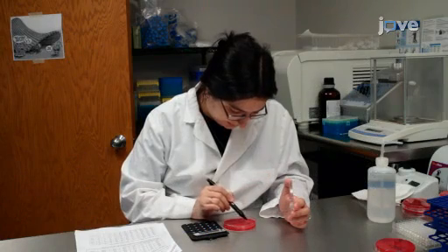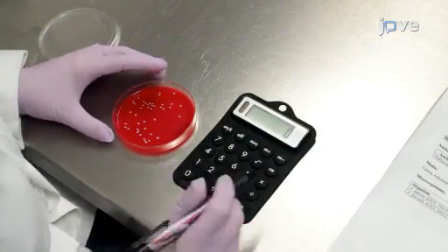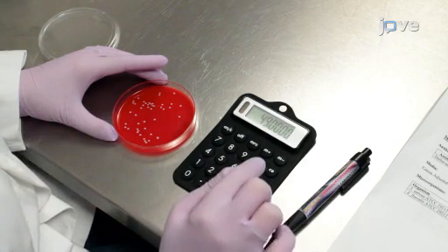Determine the number of colonies on the colony count plate. Multiply the number counted by the dilution factor. For example, 50 colonies times a dilution factor of 10,000 equals 5 × 10⁵ CFU per milliliter. An acceptable range is 20 to 80 colonies, which equates to 2 to 8 × 10⁵ colony-forming units per ml. The concentration of the inoculum is an important variable to control in susceptibility testing in order to obtain accurate results.